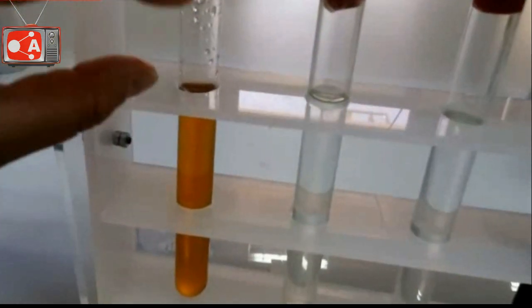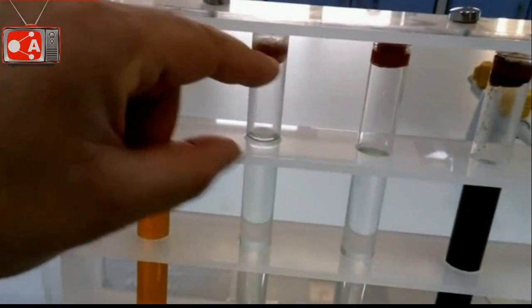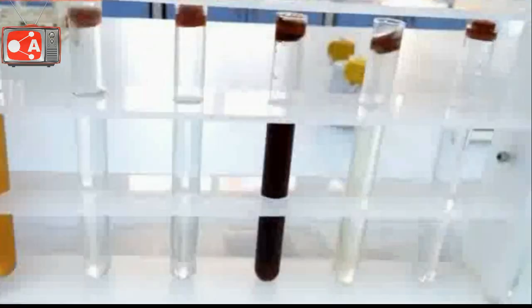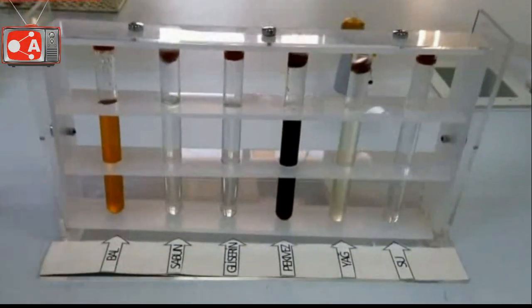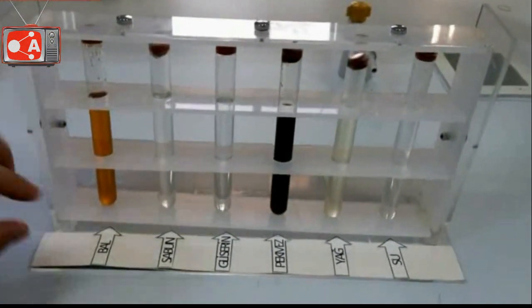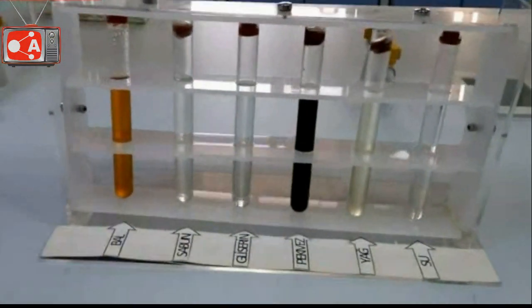As you see, liquids are put inside the test tubes and a little air is left in the upper part of each test tube equally. Each liquid was placed in equal amounts and test tubes are closed with stoppers not to spill out when they are turned upside down.